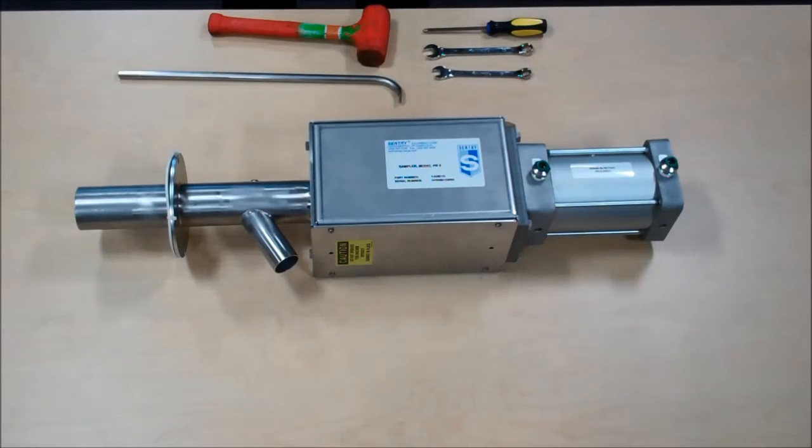This video will go through the steps of disassembling, replacing seals, and reassembling our Sentry Model PR2 Auto Sampler.